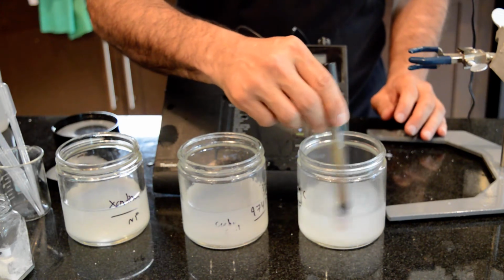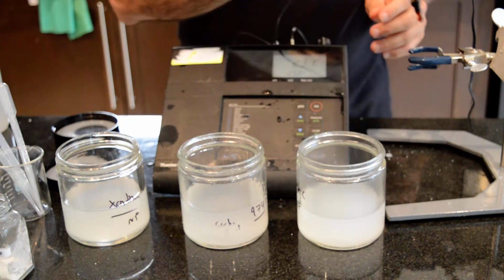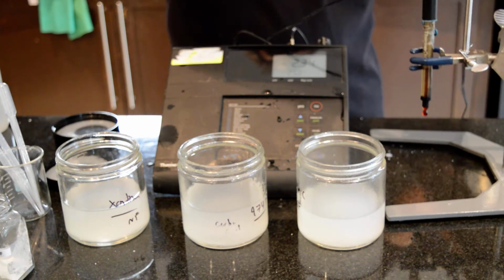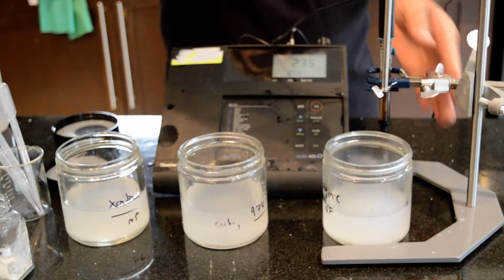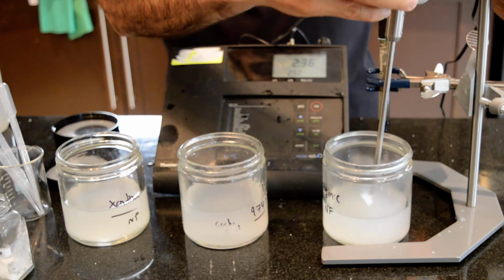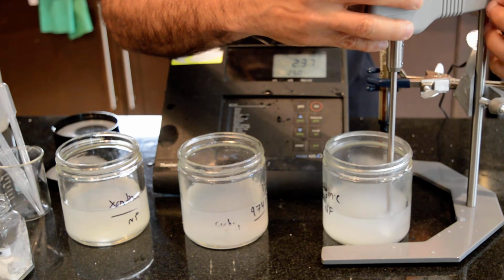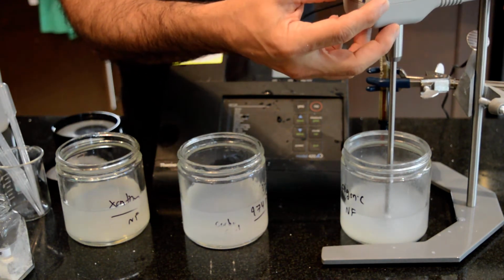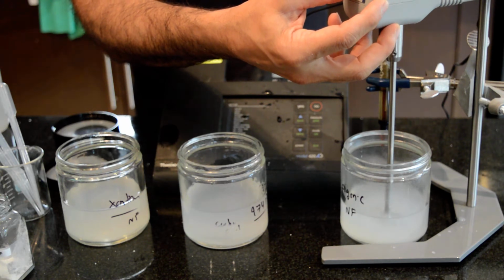So first I'm going to start by increasing the pH of the alginic acid to something around 6 to 7. I have a mixer here. I'm going to start using the mixer, and at the same time we are going to adjust the pH. Alginic acid is not even mixing, the viscosity is very low, and it's not giving me any feeling of a gel. It's very much like a liquid.